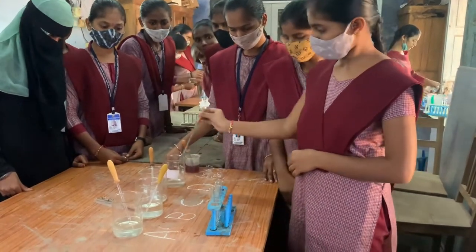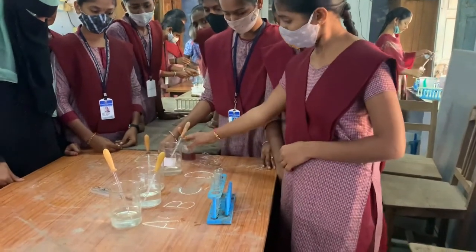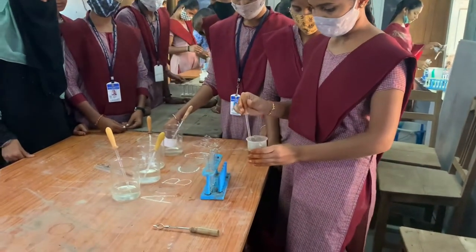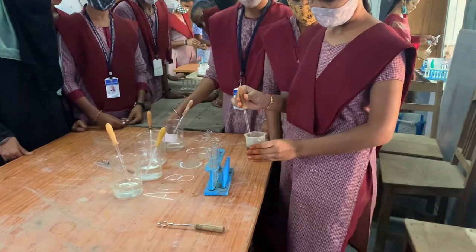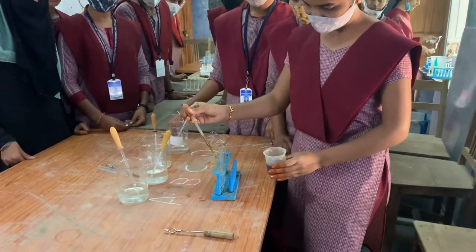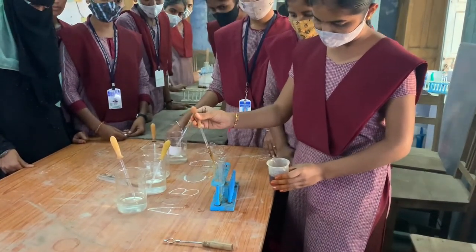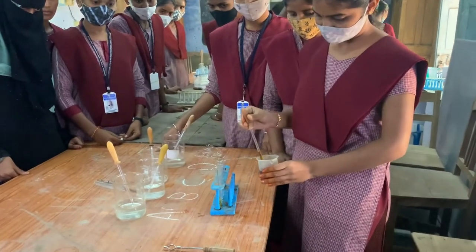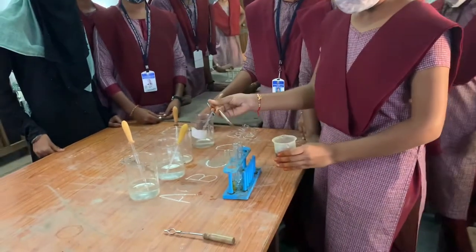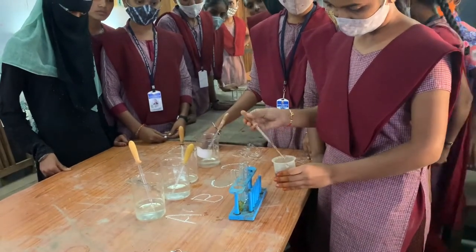Into each test tube we have to add one ml of iodine solution. So add one ml of iodine solution to test tube one, then test tube two, three, and four.